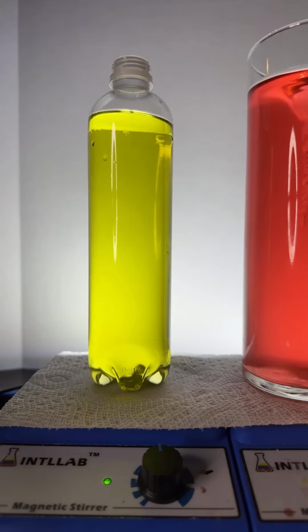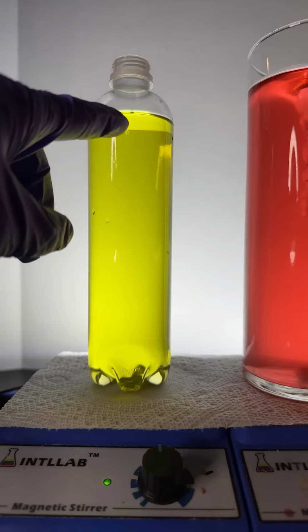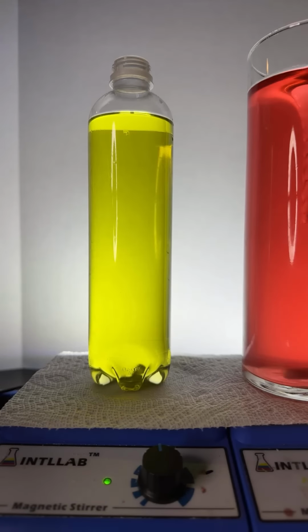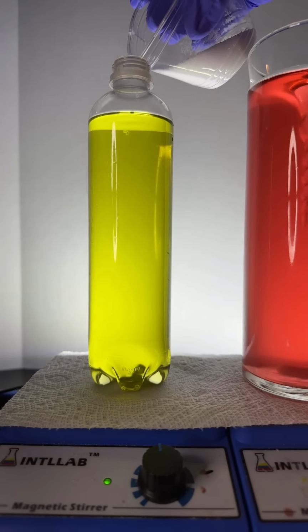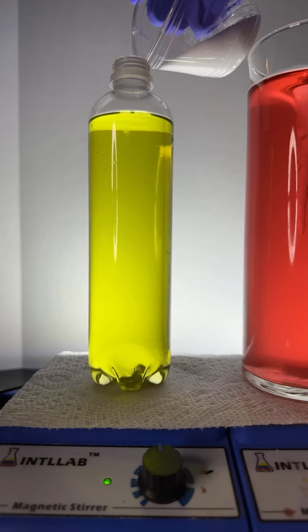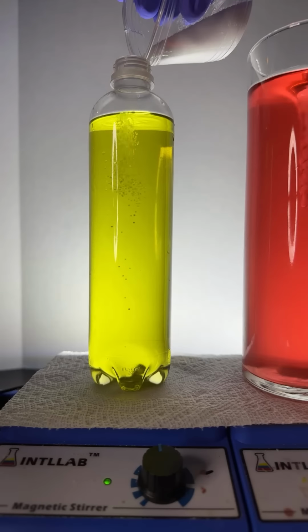Why does vodka stay mixed instead of separating water and alcohol? Dennis, just like here, alcohols with a small number of carbons mix very well with water. And the alcohol that people drink has 2 carbons in it. This alcohol here has 3 carbons in it. And small alcohols like that mix real well with water. Okay, now we've got a mixture of water, isopropyl alcohol, and some universal indicator. I'm going to put some salt in here.